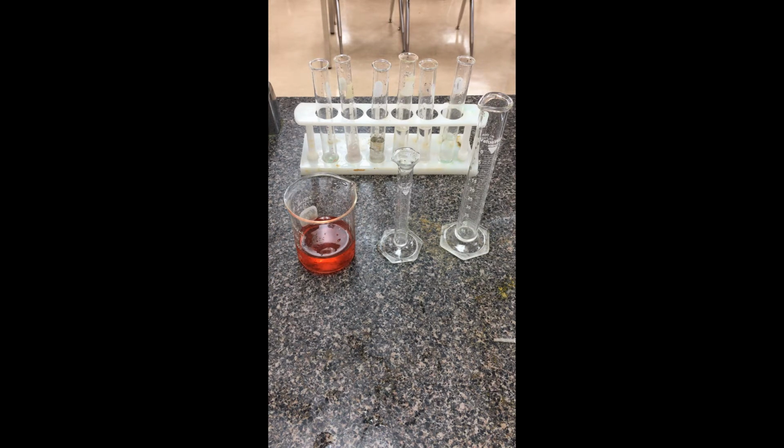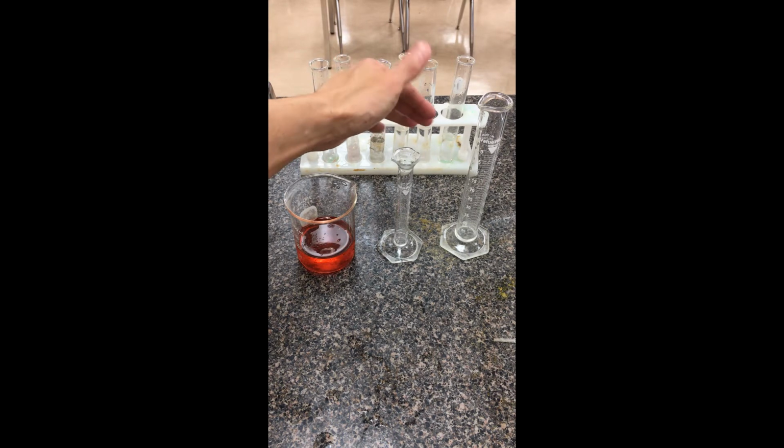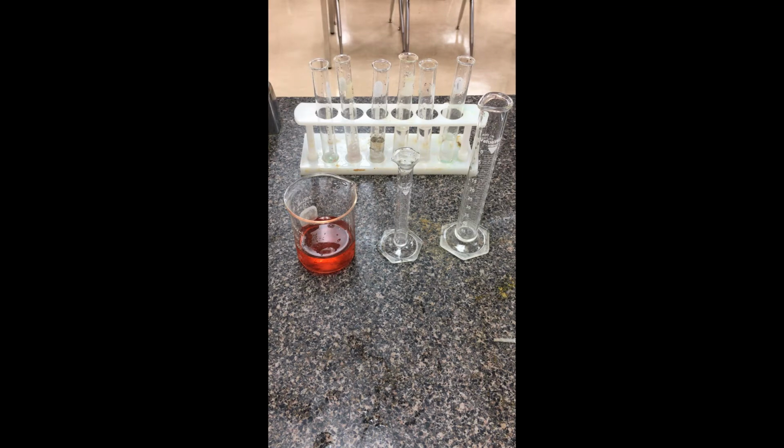The next part of this experiment involves doing a few dilutions. We're going to take our stock solution and follow the manual in terms of what to dilute. We're going to line up our test tubes: I have A, B, C, D, E, and we're going to create an unknown on the far side. To save a little time, I've already measured the volumes of water I would need and put those in as well. So all I need to add is my stock solution.